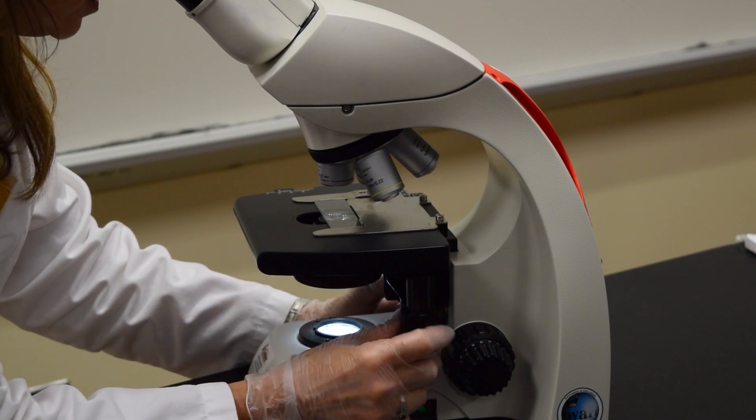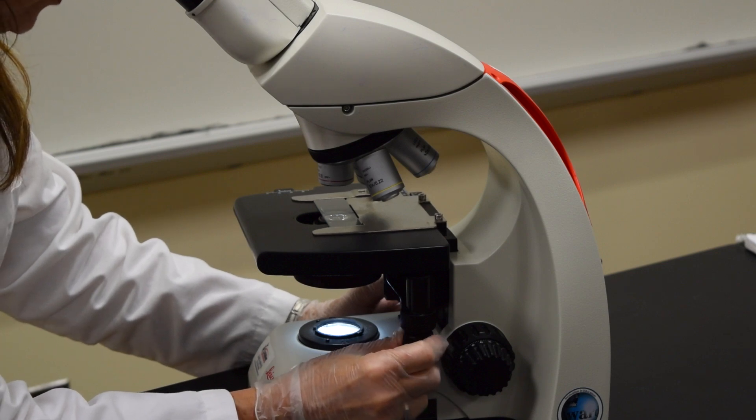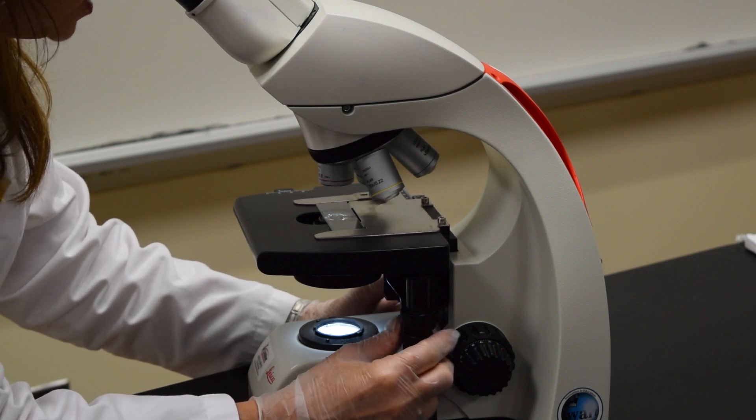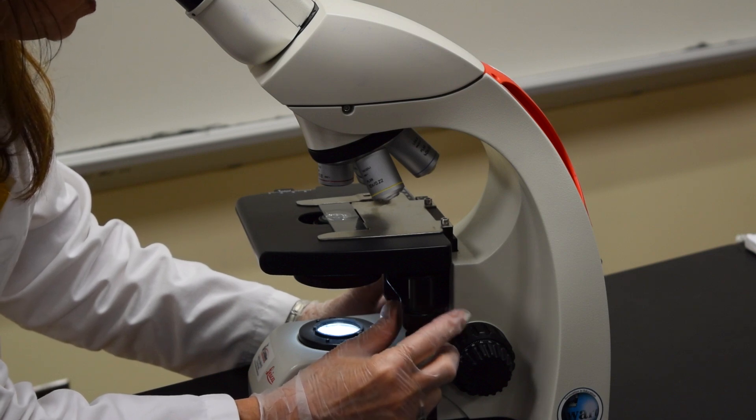Then use the stage arms knobs and move toward the center of the slide until you get an air bubble, a piece of dust in focus.